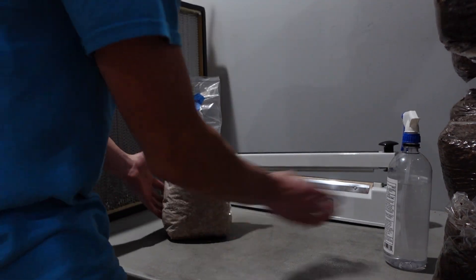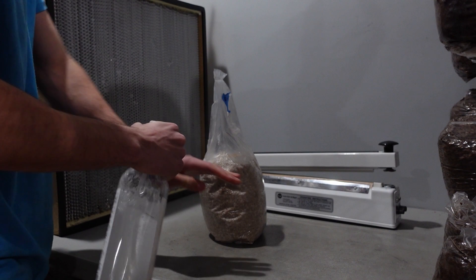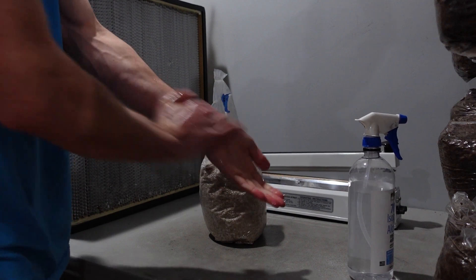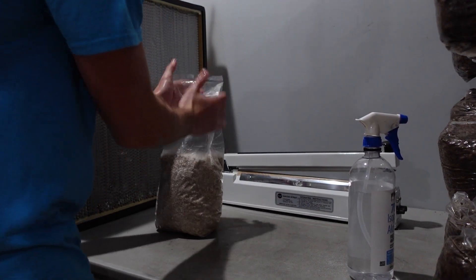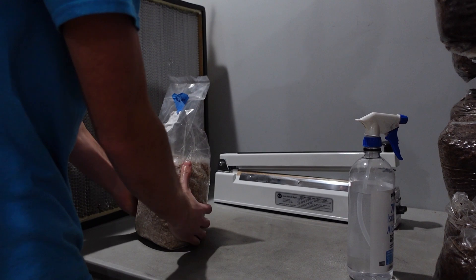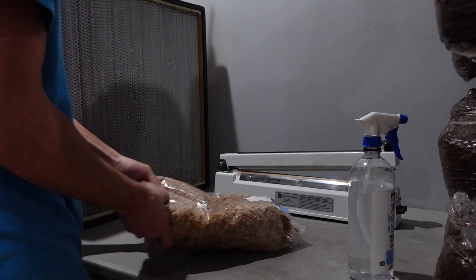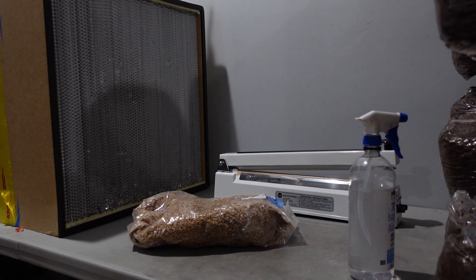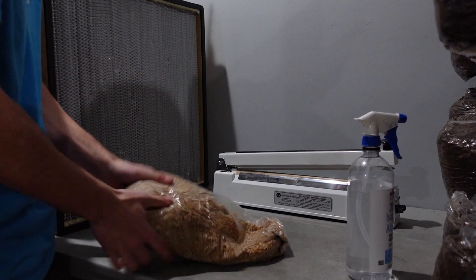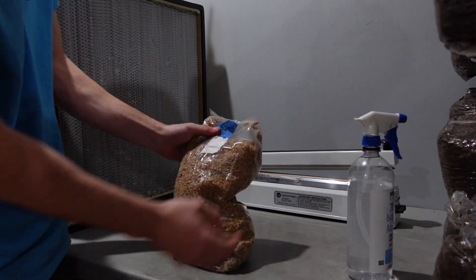I'm going to go ahead and just clean this up — squirt it down all around, inside the gussets, under the bag, around the bag. Also going to squirt down my hands. You can wash them before if they're dirty, get it all clean from the sleeves a little bit. Now I have my block here. Just going to wipe my hands on the bag and make sure it's nice and clean there. Then I'm going to go ahead and break up the spawn bag. It's pretty recently colonized so it breaks up really nicely, and now we've got all these beautiful little grains. This is blue oyster mushroom, by the way.